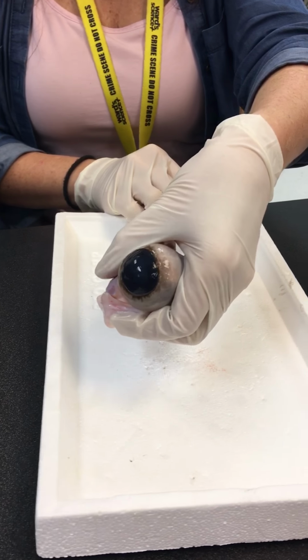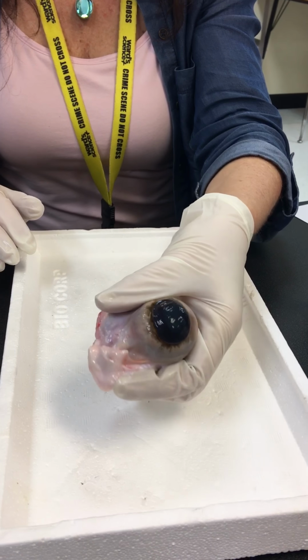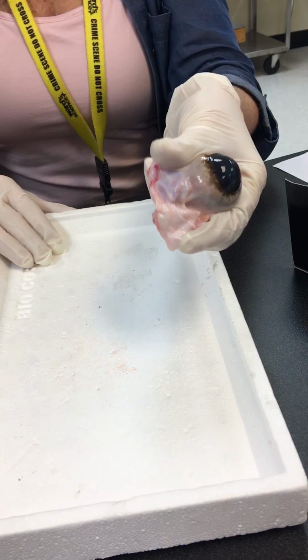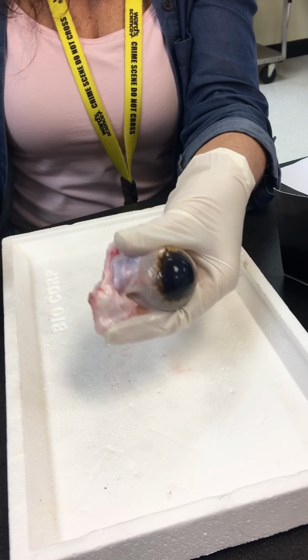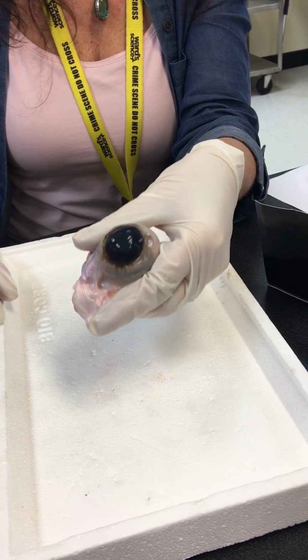Look at the cow eye. You can see it's like a hole. And you notice that a lot of animals, cows included, have a reflective, reflector type look to their eyes. Maybe it's a little easier to see this way. You see the reflector part? Okay, we're gonna take a look at the structure that does that.